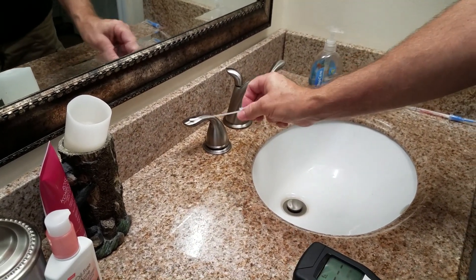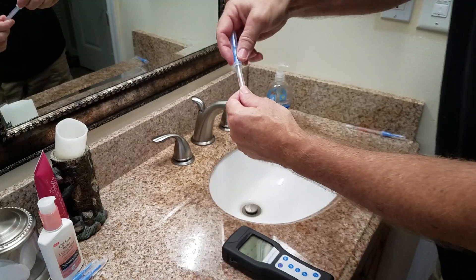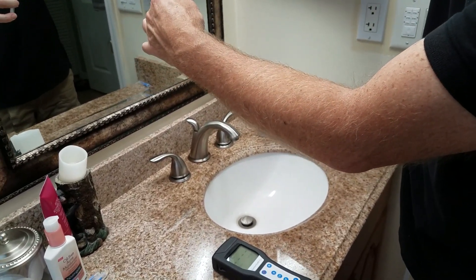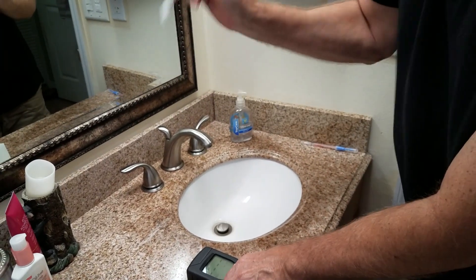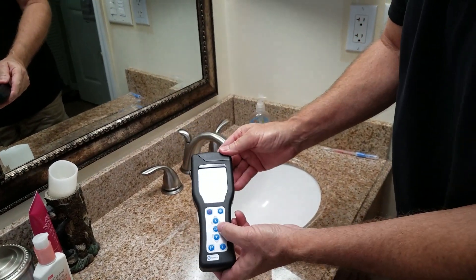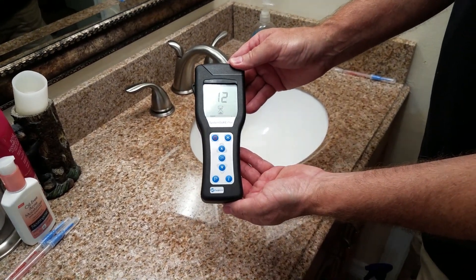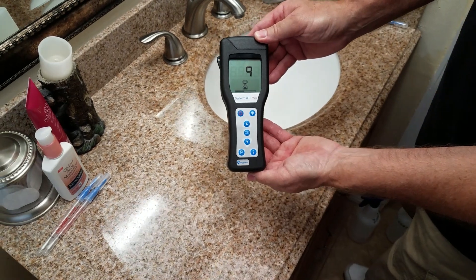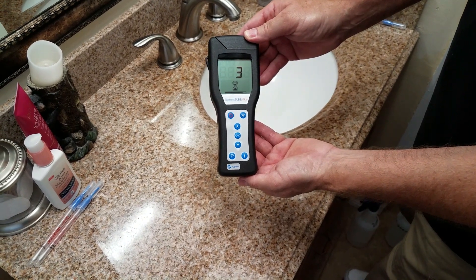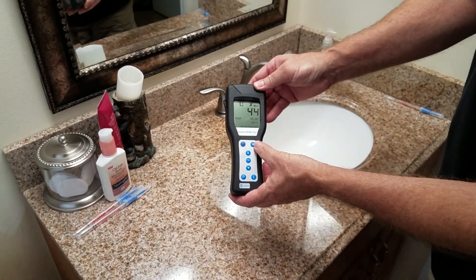Got to spin the Q-tip, put some pressure on it. Okay. So it's lower — much better.